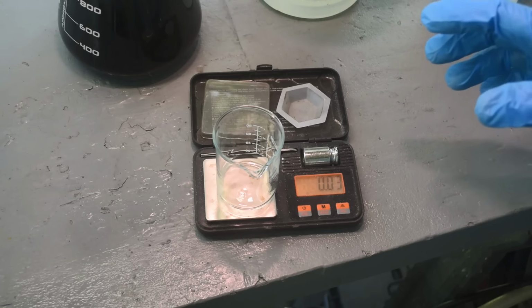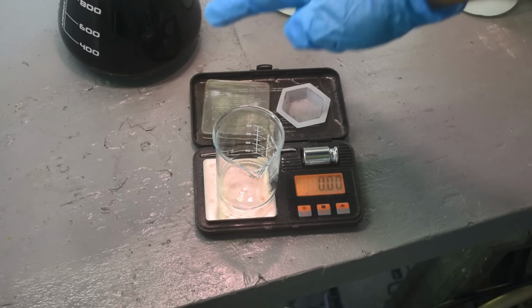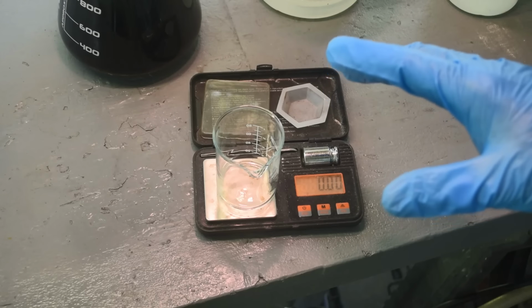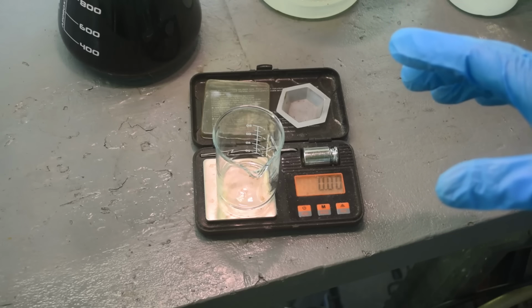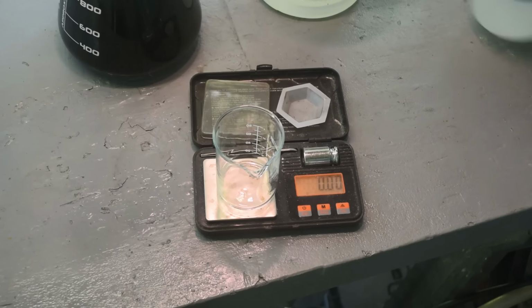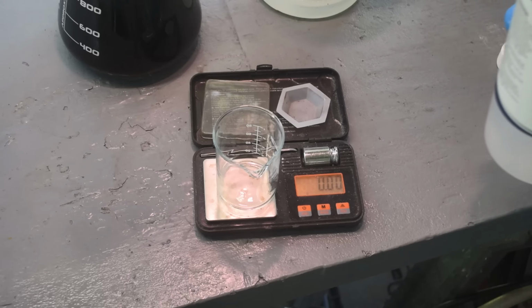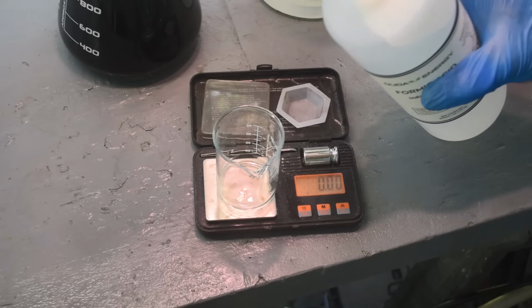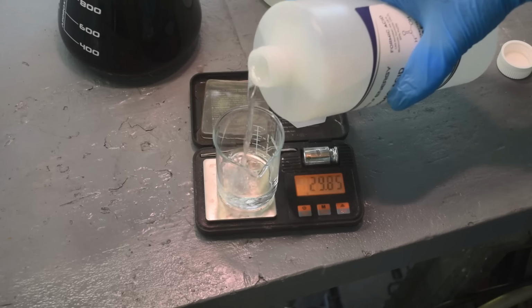So I'm expecting to get, at the most, maybe 20 grams of palladium out of this stuff over here, based on my small-scale tests. And there were some losses. If you watch the other 6 videos in this series, you know I've had some issues. So I'm sure there's some losses. Some of the palladium has made it into my stock pot. Some of it has made it into my rag and filter storage. So we may not get the full 20 grams I'm expecting here. We'll see. Again, my formic acid also is kind of old, so it may have lost some strength. So I'm just gonna double it. I'm gonna get about 40 grams of formic acid here.